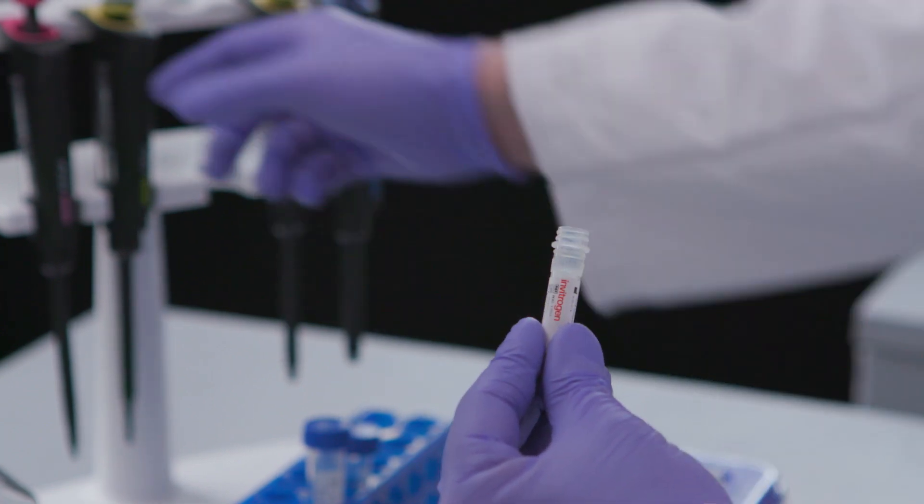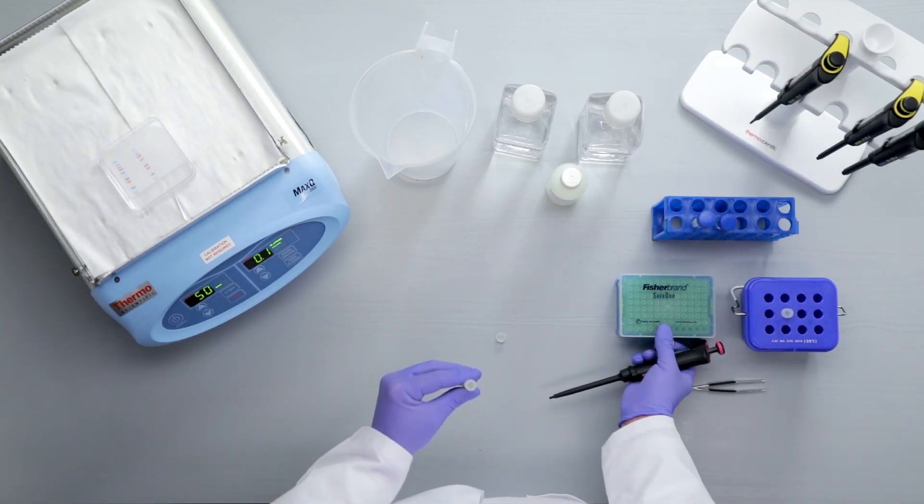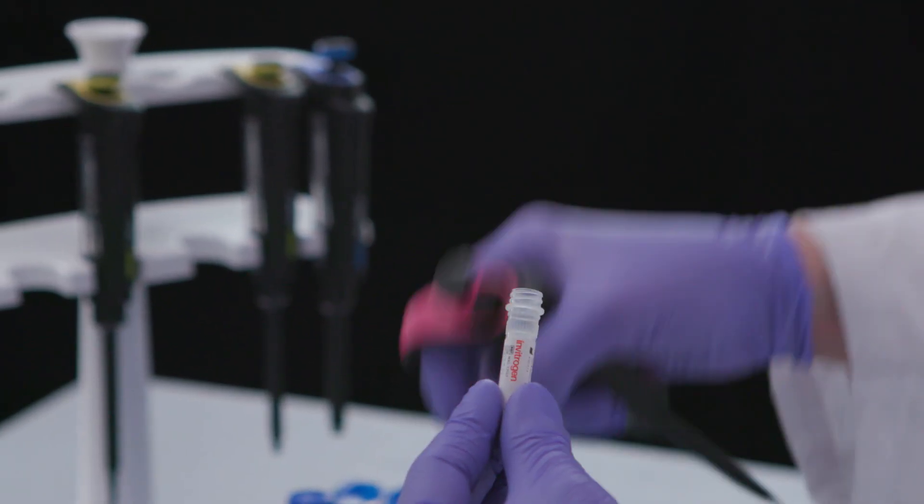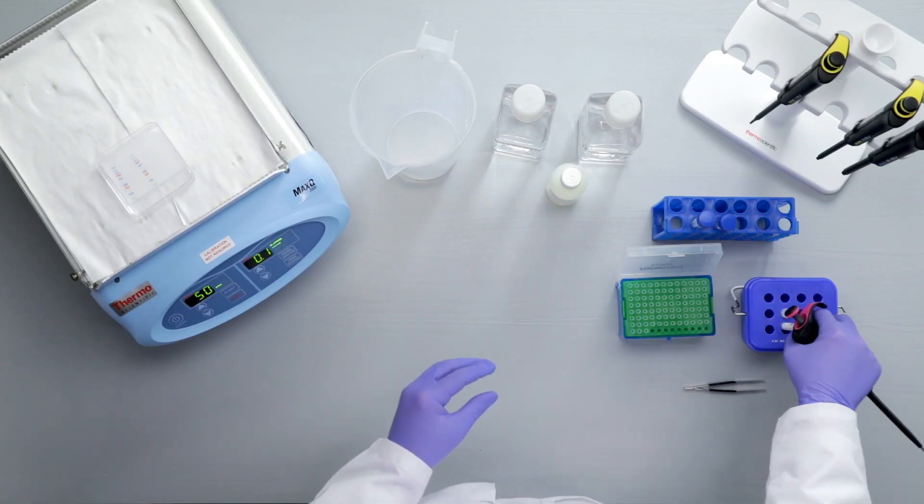Now the blocked membrane is ready to be probed with the primary antibody. The primary antibody should be diluted in blocking buffer per supplier recommendations, with or without detergent.